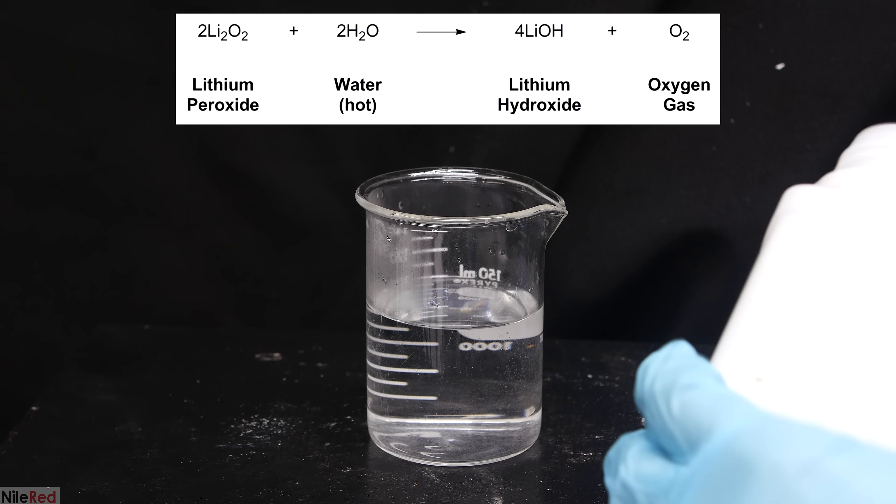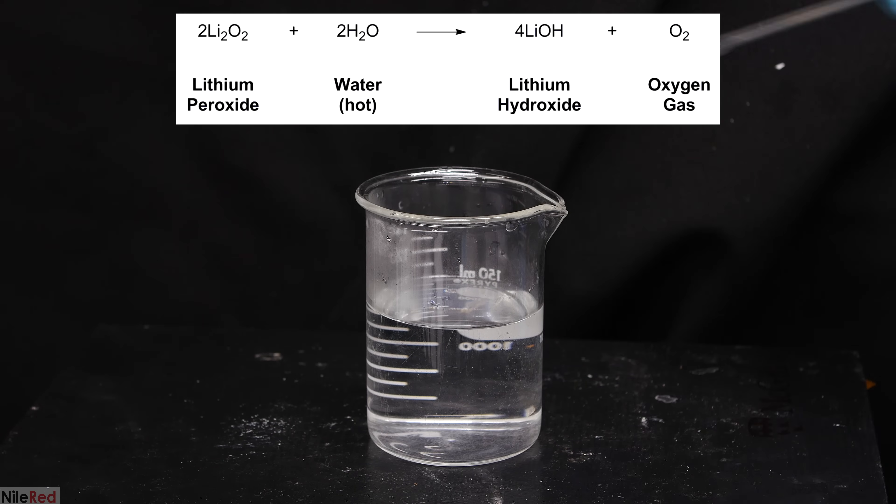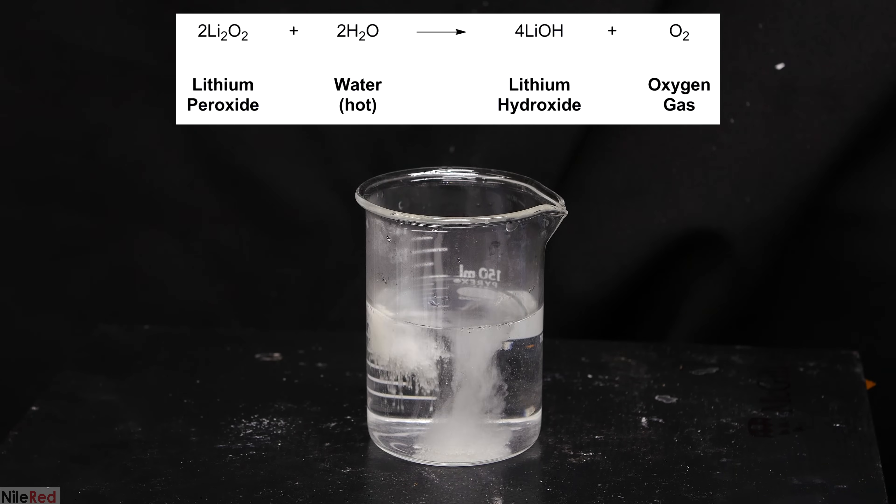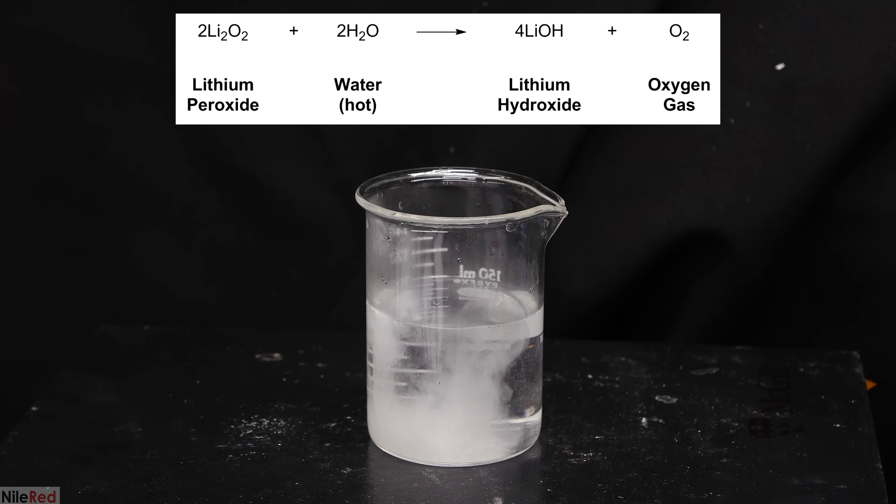As a final experiment, I added a little bit of lithium peroxide to some hot water. When it's added to hot water, it very quickly reacts to form lithium hydroxide and oxygen gas.